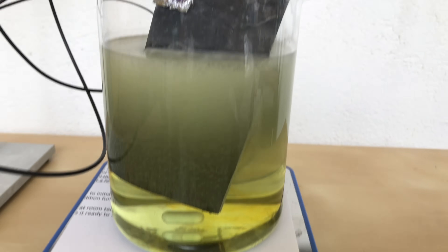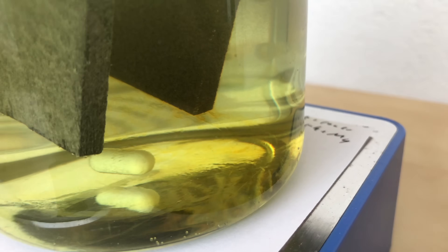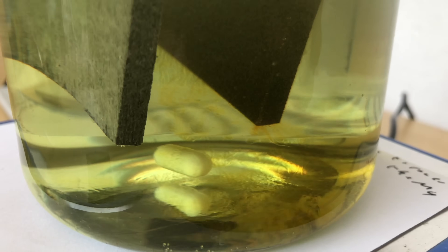The power supply and the magnetic stirrer were turned on and we ran the cell at about 3 volts and a lot of amps. When not stirring and taking a look at the electrodes, you can see that some red stuff is being generated at the right electrode — this is bromine. On the left electrode you can see a gas — this is hydrogen.